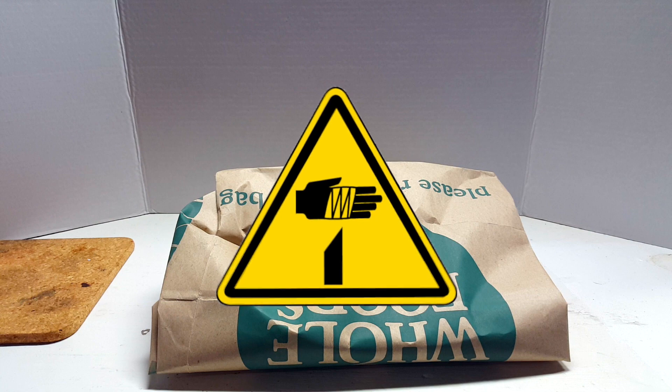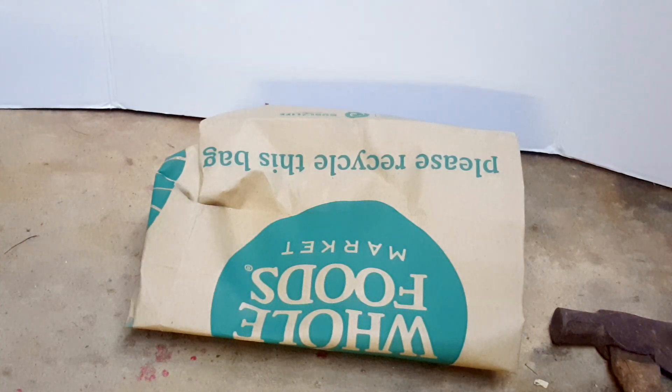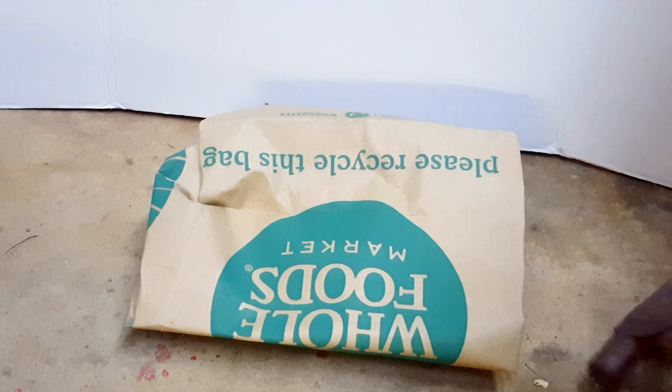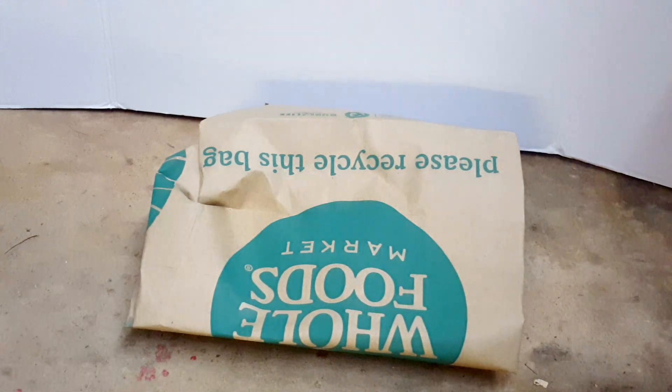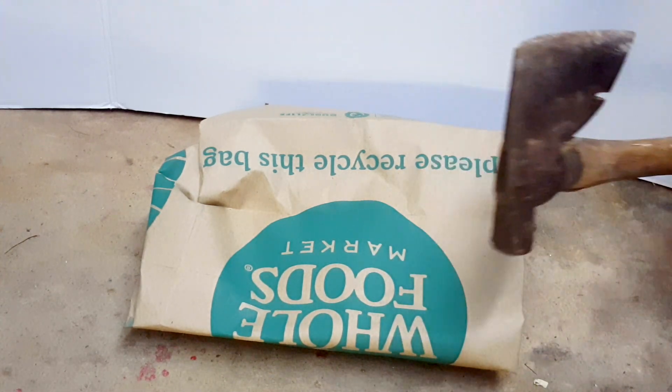Just a word of safety though, you should always wear thick gloves when dealing with glass, as well as eye protection. Before hitting the glass with a hammer, a hatchet in my case because I didn't bother going to get a hammer, make sure to move the bag to a solid location that won't budge.